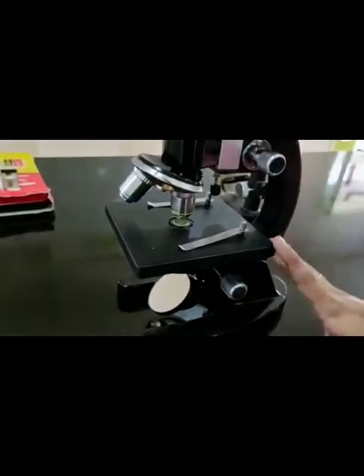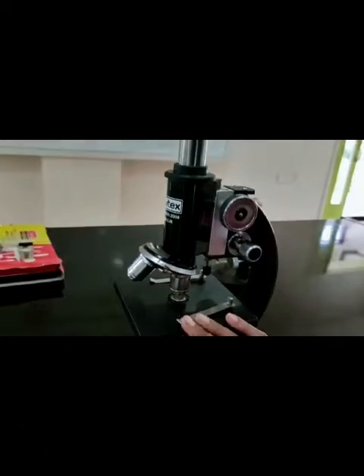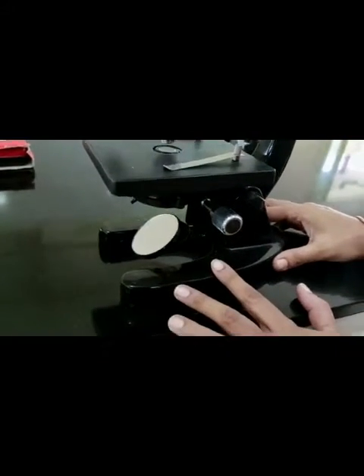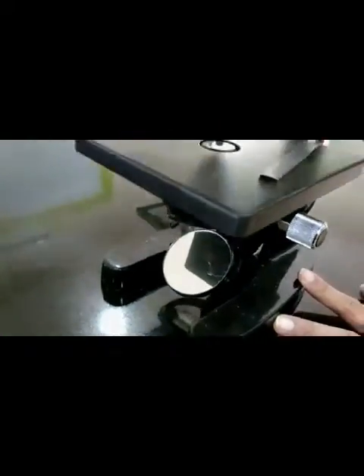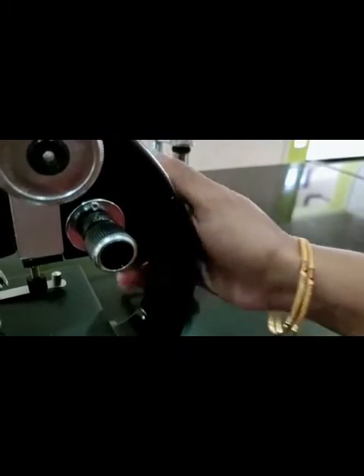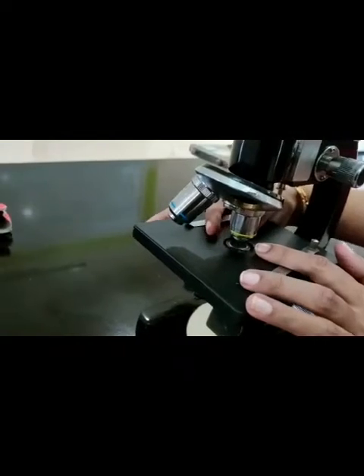Now we move to the compound microscope. We will start from the bottom. This is called the horseshoe stand or the foot. Then here we have the holding arm. Then here is the stage on which the slide is going to be kept, and these are the clips.